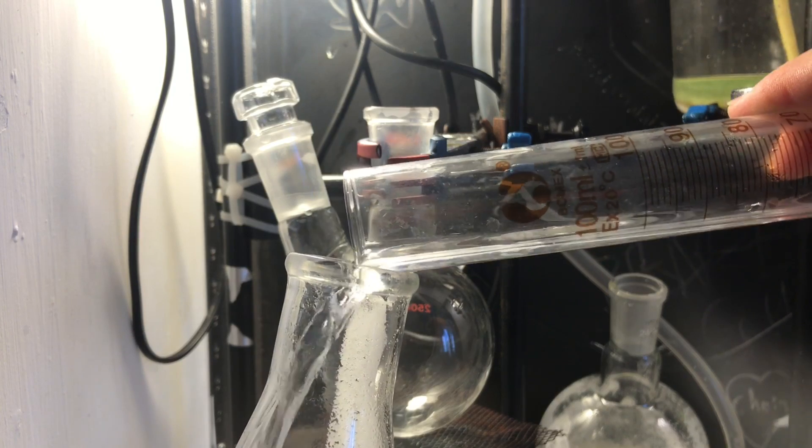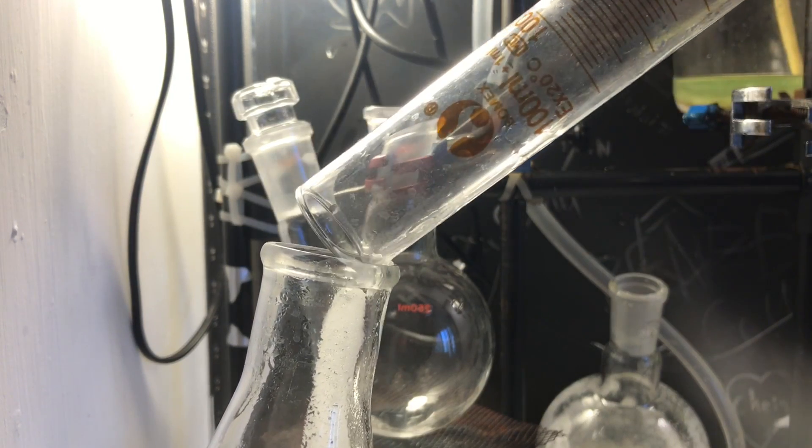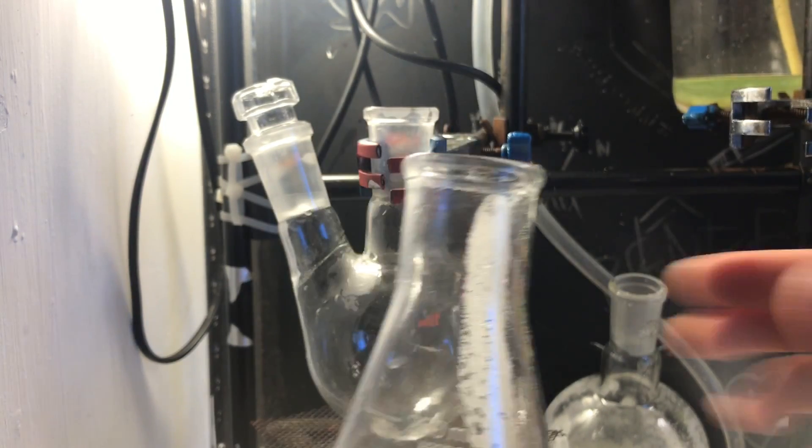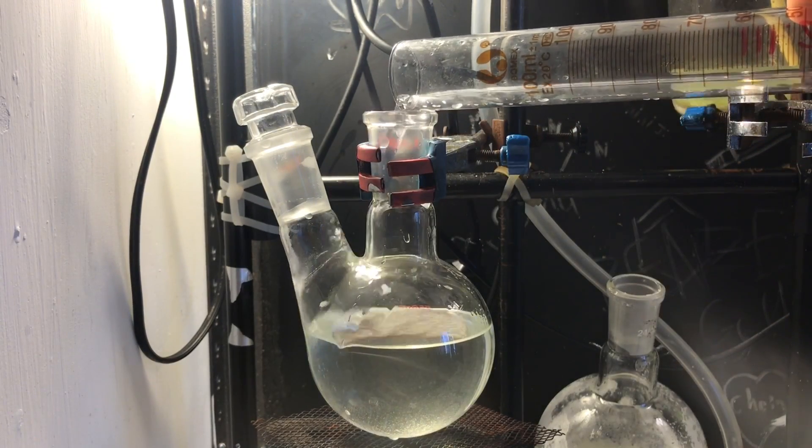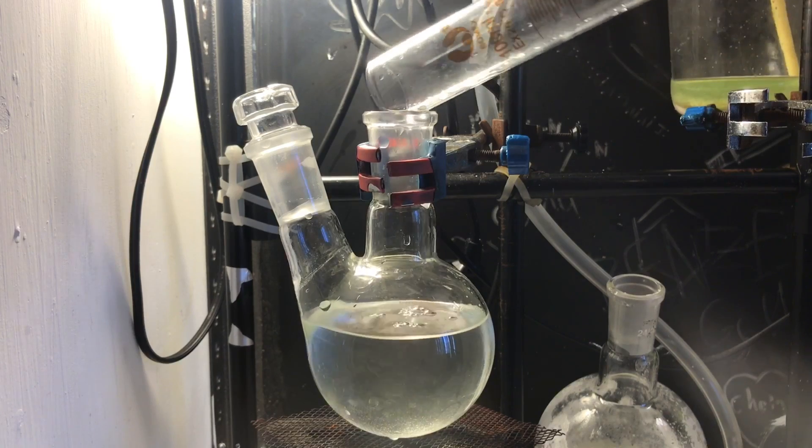Now, combine your HCl. Well, for me, I have to combine it, but if your HCl's pure, it doesn't need it. But anyways, we're gonna distill it, so add it into a flask and just set it up for distillation.